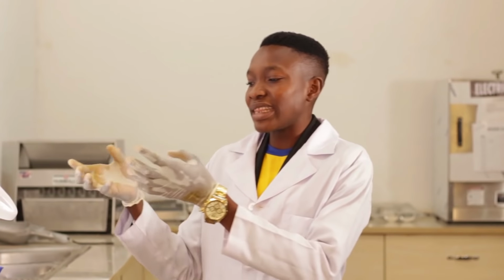After conducting your purity test and separating it into different components, you calculate it on percentage basis. That will enable you to project, if with this little quantity of rice I have here, there is this amount of other seeds or chaffs, then there is this percentage of that other seeds in the one in the store.